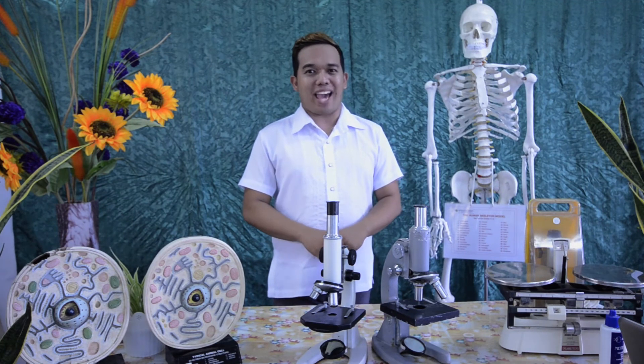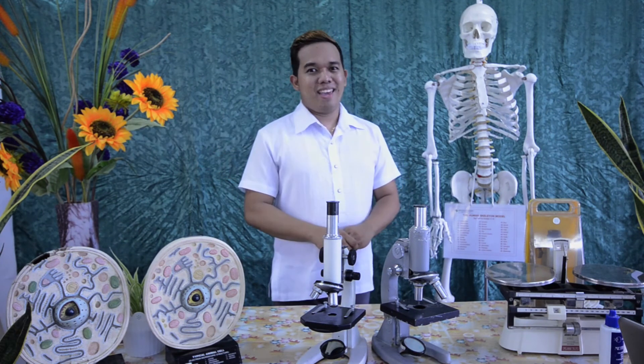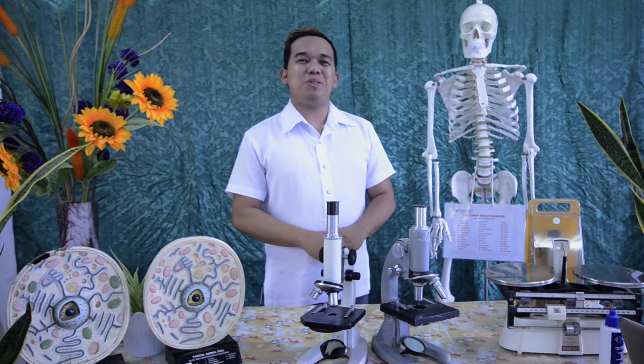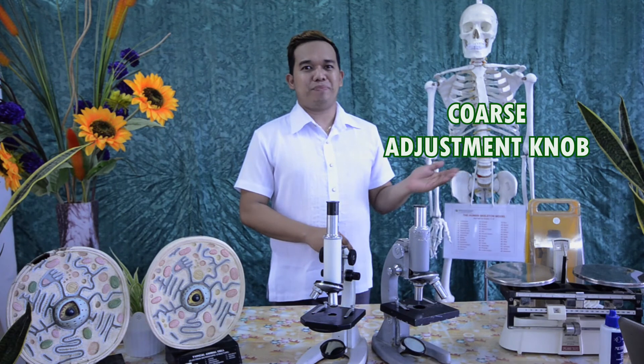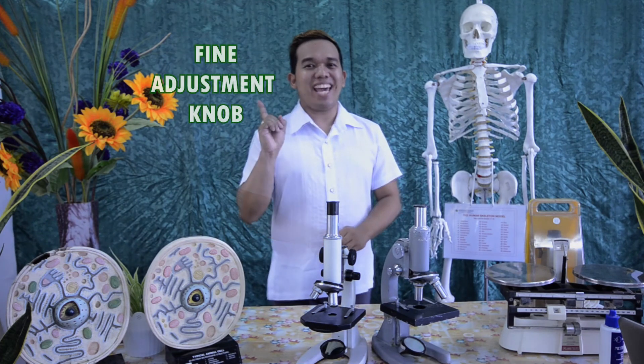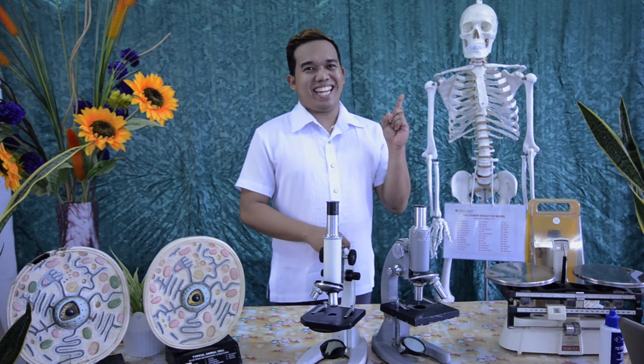Now let's check your understanding. What part of the microscope regulates the intensity or amount of light entering the microscope? Correct, it is the diaphragm. It is a large-sized knob used to move the body tube up and down for bringing the object into focus. Correct, it's the coarse adjustment knob. Exact focusing is done by this knob — the fine adjustment knob. It is a lens fitted at the top of the body tube — it is the eyepiece. It is used to reflect light rays into the microscope — it's the mirror.